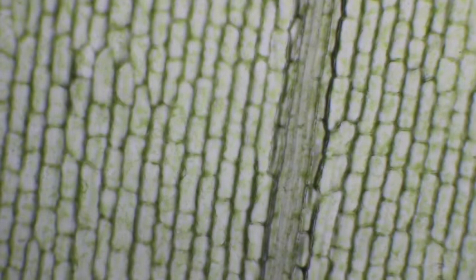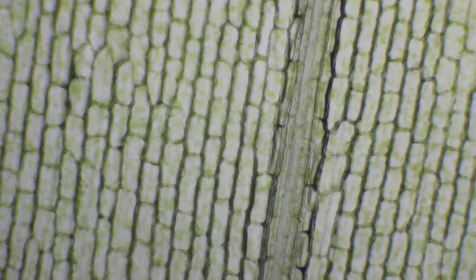Here is our leaf under 4x magnification — a total of 40x. See those little bricks? Those are all cells. It's green because it's photosynthetic. You can see a little bit of movement in the very center — that's vascular tissue, xylem and phloem flowing through the center of the leaf. To either side are all your leaf cells. You can see it has many layers.